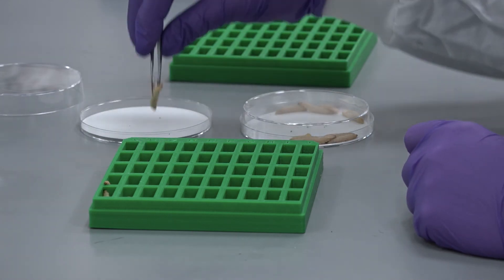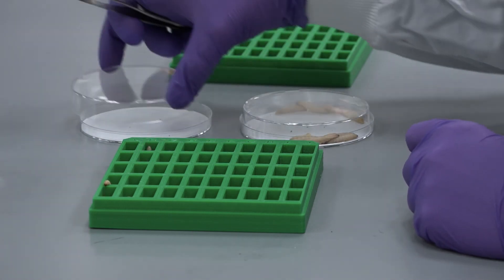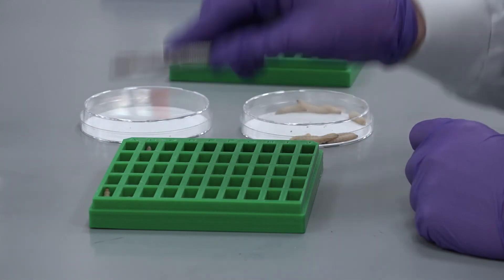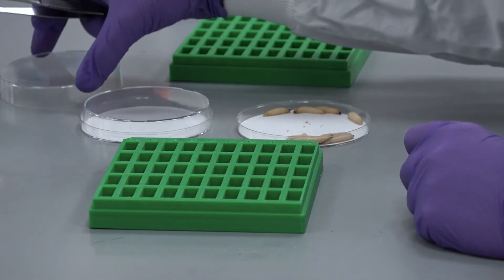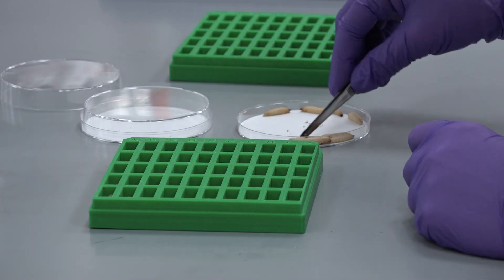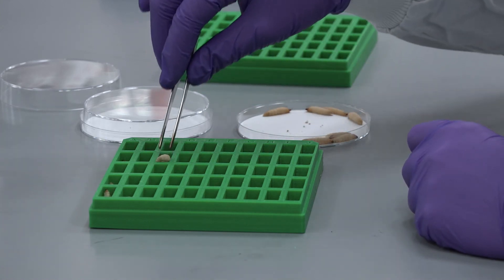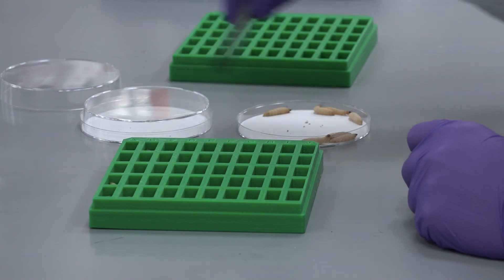If you are using a bioluminescent strain not supplied by Biosystems Technology, then you will need to do experiments to determine your time course and when best to image your larvae depending on the infection dynamics of your strain.